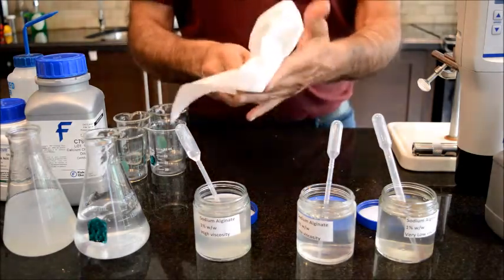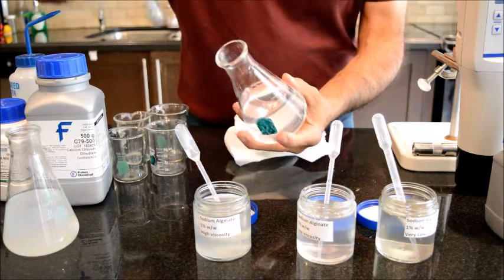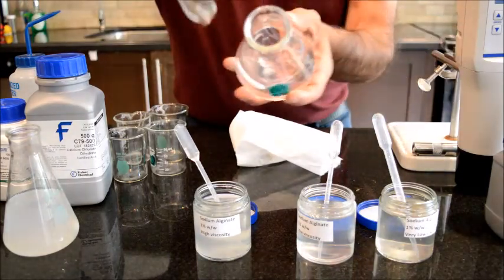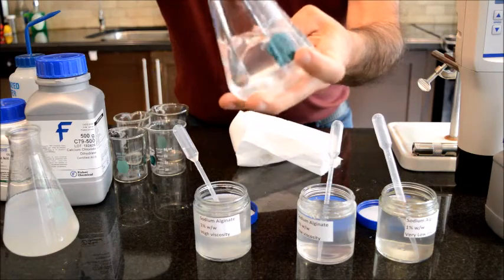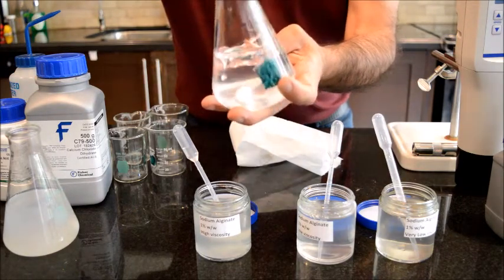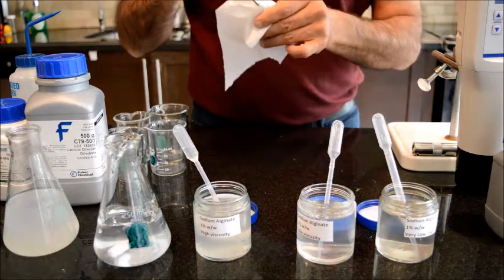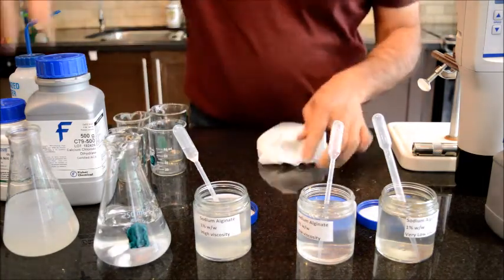Now, in comparison with 1% carbomer, we see that the carbomer definitely is a gel, and this material has much higher viscosity than alginic acid. Okay, I made a little mess here. So, as I said in my previous video, if you would like to make a gel product like a hair gel, carbomer is the polymer of choice.